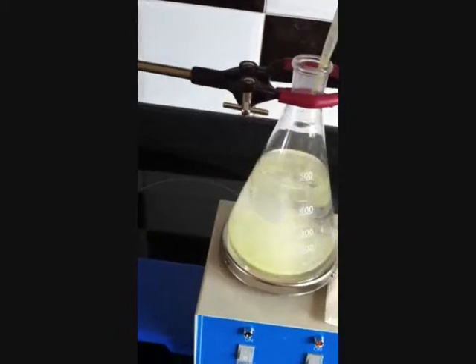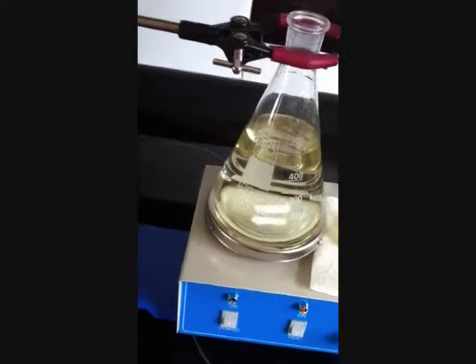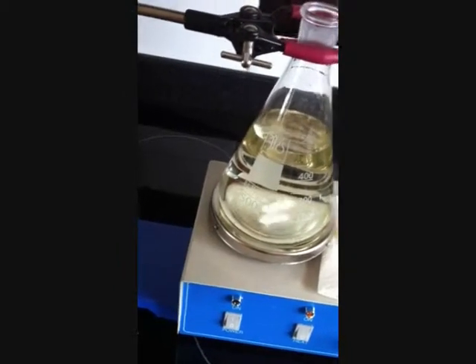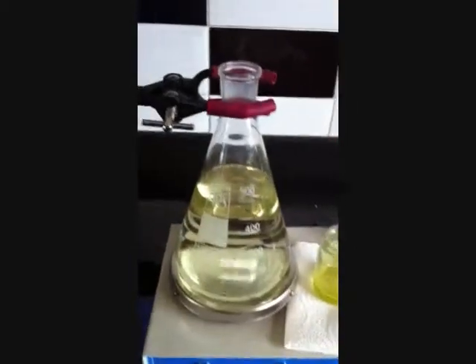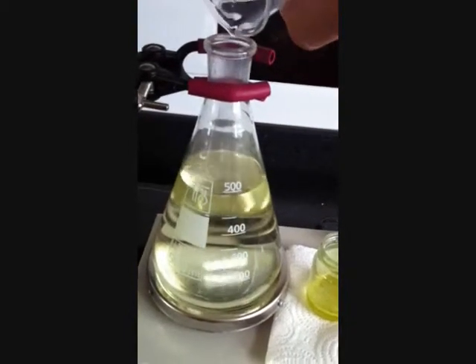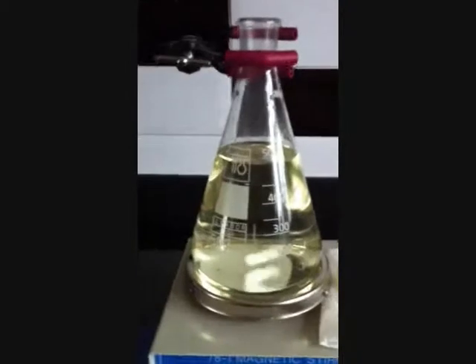Just take two. I have got the water ready — put some gold solution into it. I am going to put less sodium citrate in this one, so let us just hope it is not the gold that is causing the problem. We have got roughly 1.5 grams of sodium citrate solution, but unfortunately my scales are not very good so it could be a little bit more. It has not gone black straight away, which is what we want. So let us see what happens to this one.